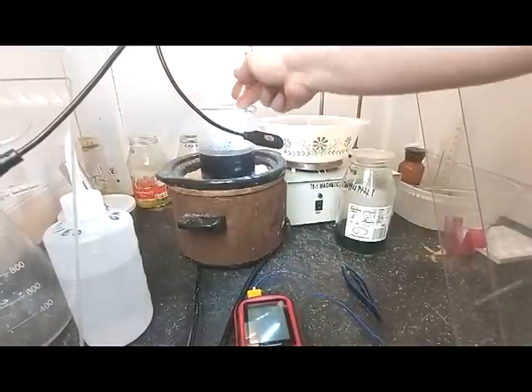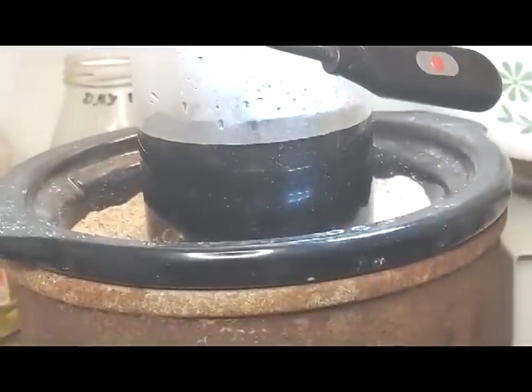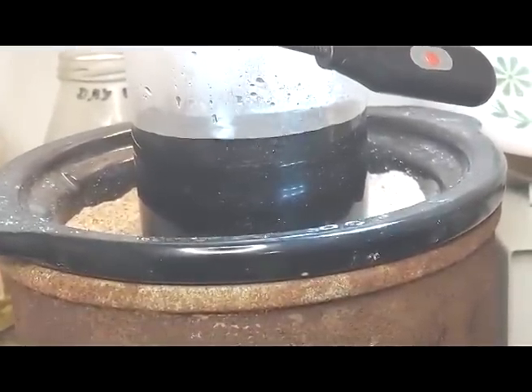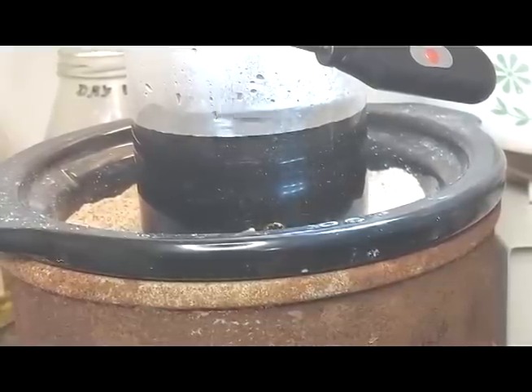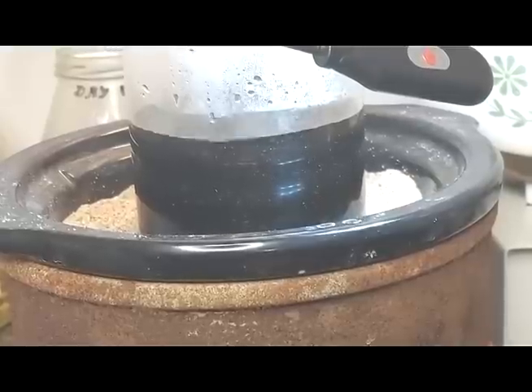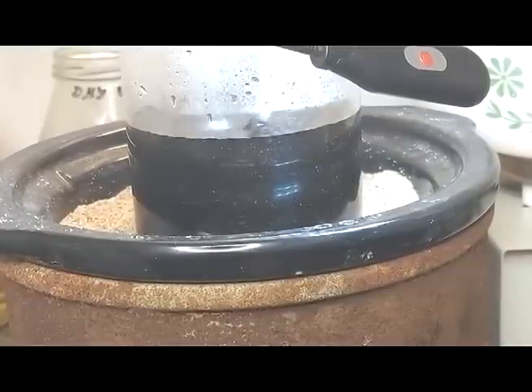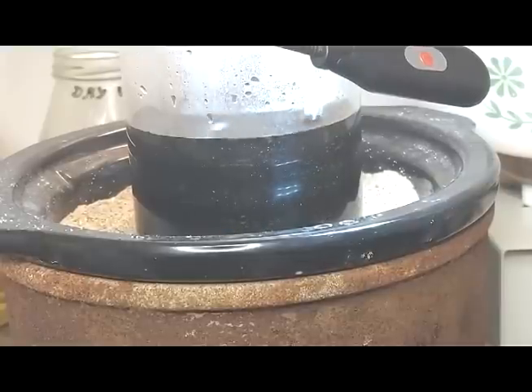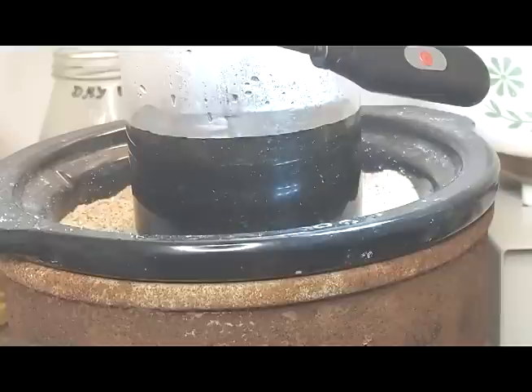Another update, and I am liking what I am seeing. You can see that real clearly on the camera — that's all gold separating from the gold-plated material. We'll be real careful not to add too much hydrogen peroxide because, technically, we could put this in the Aqua Regia. But there have been some recent experiments from other YouTubers that kind of disproved that — it just simply doesn't work. I'm not taking a chance. Anyways, that is excellent.